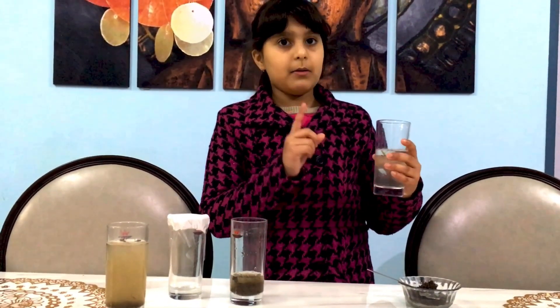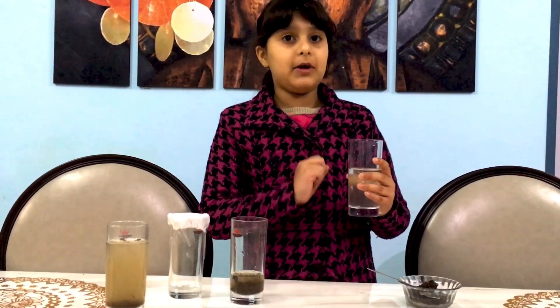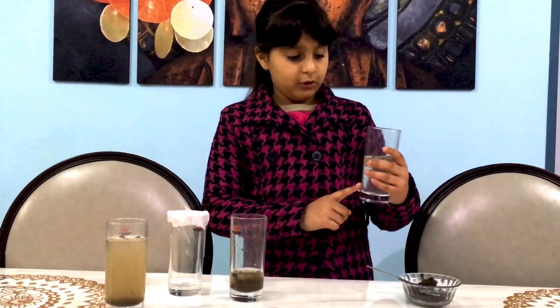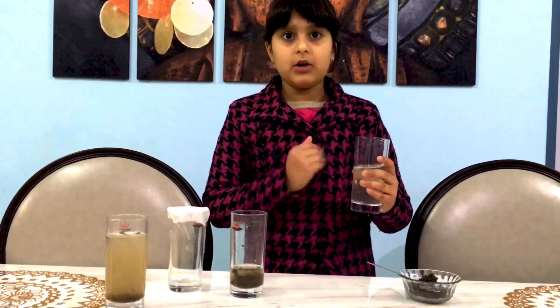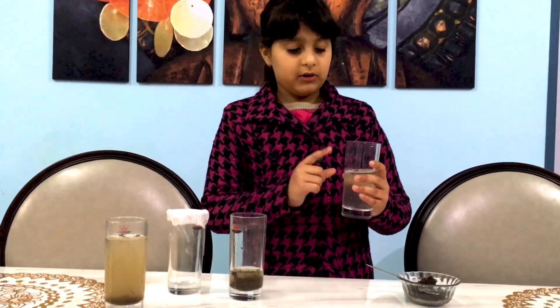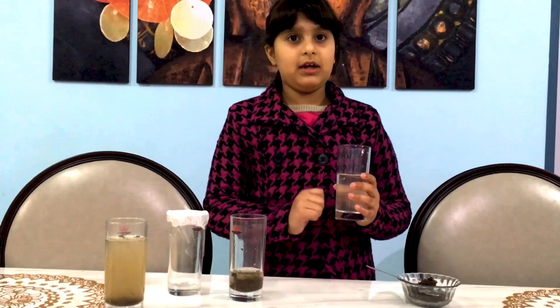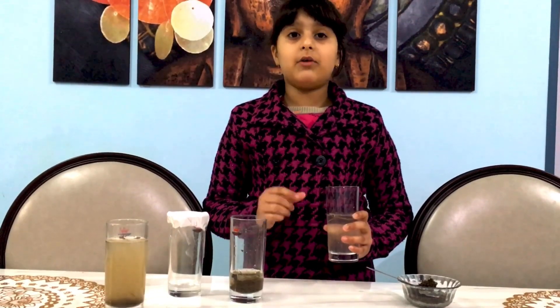But still here you can see the light impurities that were floating are still present. So this is not that much clean. We cannot use this water also. So this process is known as decantation. The process in which we pour our supernatant liquid water into another container gently without shaking it is known as decantation.